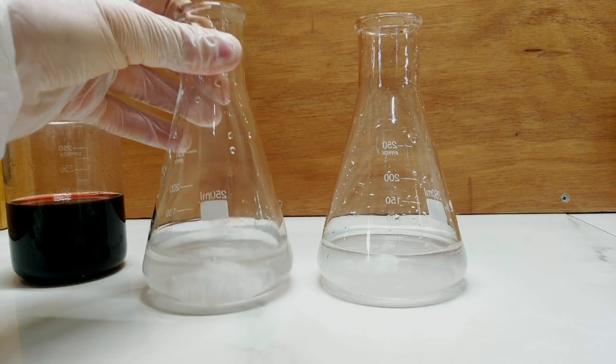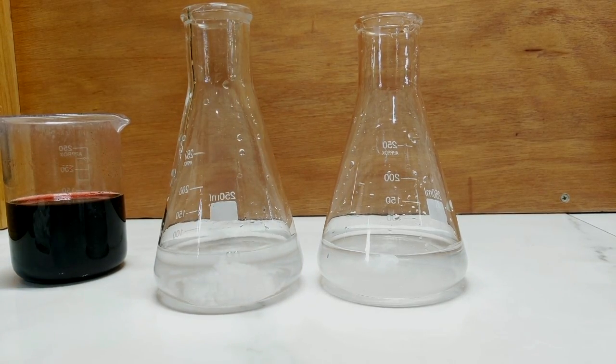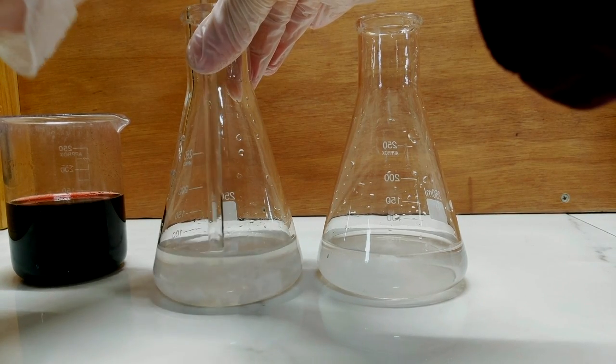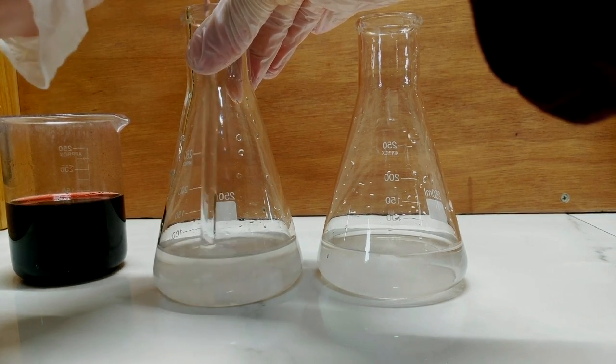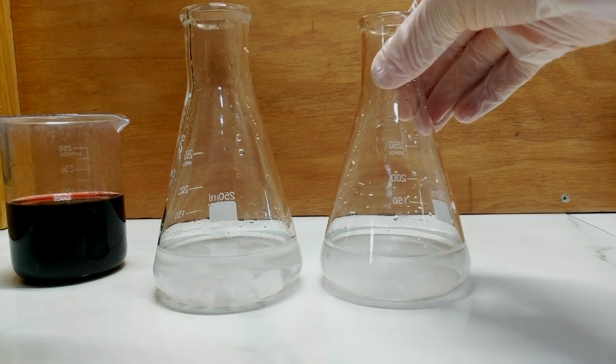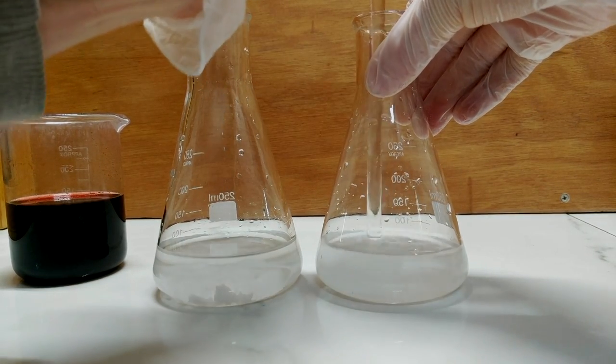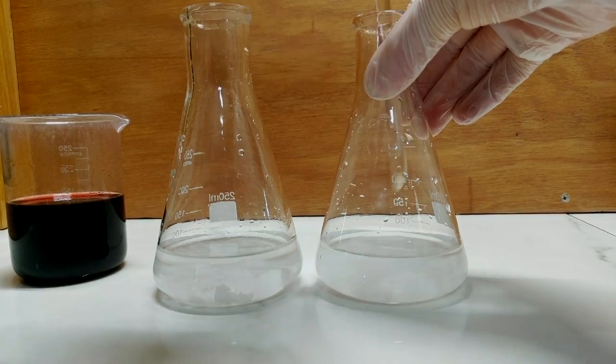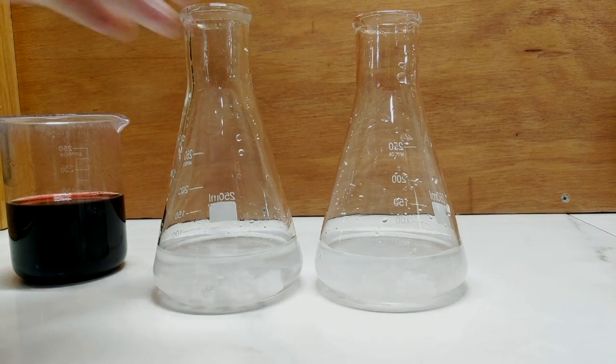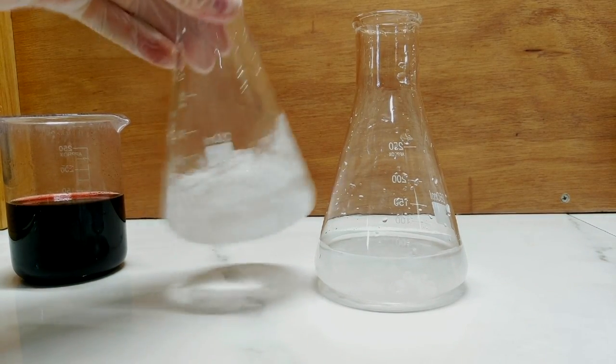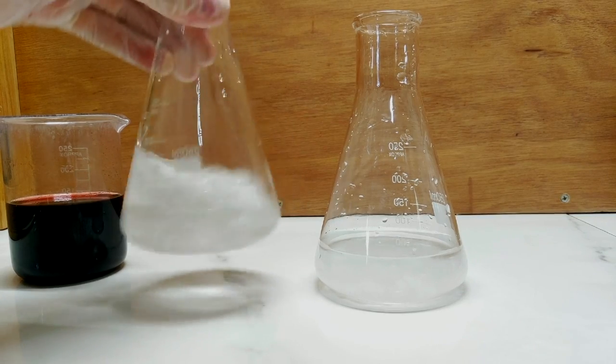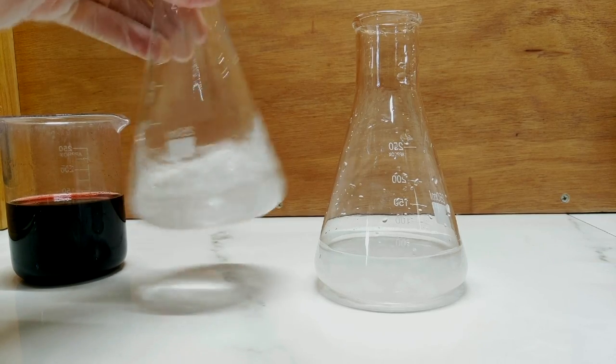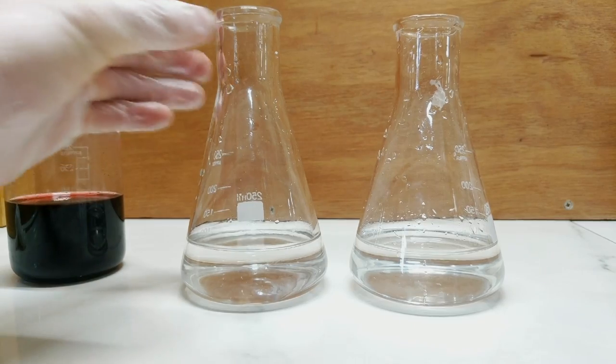So I'm just going to get a little stir rod and get this stirred. It's interesting it seems to go quite hard on contact with water. So that's a fun little development. I could put these on the stir plate and stir them but I can't really be bothered at the moment setting that up. So I'll just stir it manually.